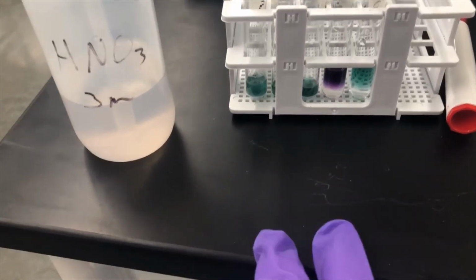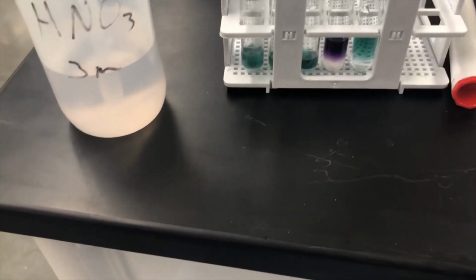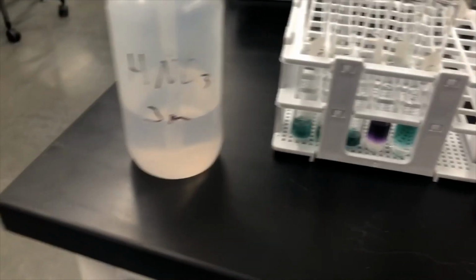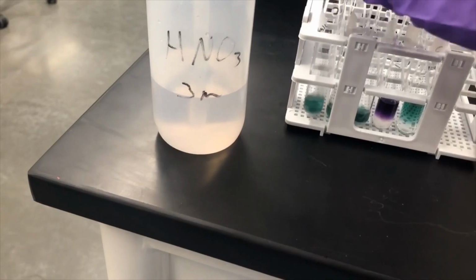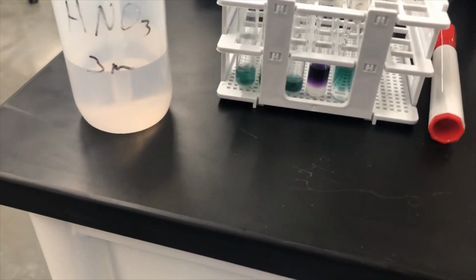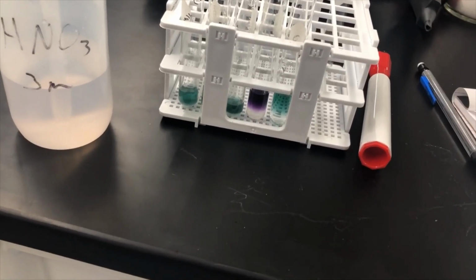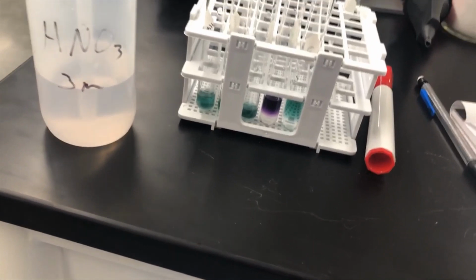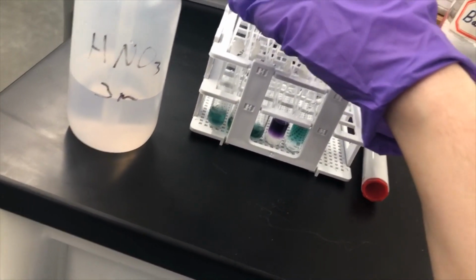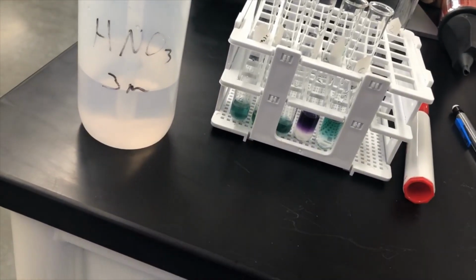So if it fizzes, that means that there is a carbonate ion present. So there are two compounds, the barium carbonate here and then the sodium carbonate here, that have carbonate in the compound. But remember that one of those, barium carbonate, was insoluble. So in theory, this guy shouldn't fizz at all because the carbonate is still in its molecular form. It's not an ion.